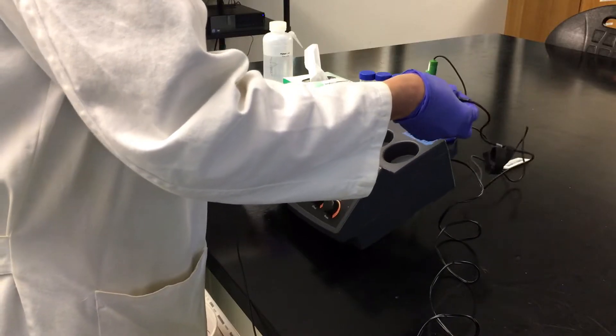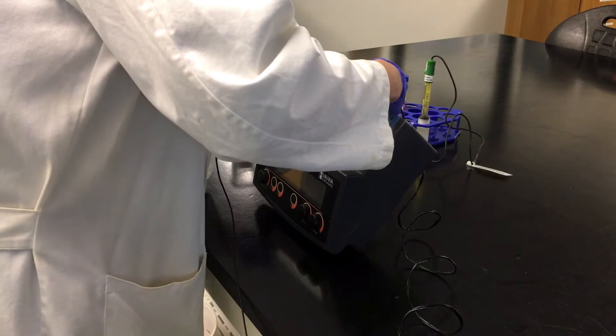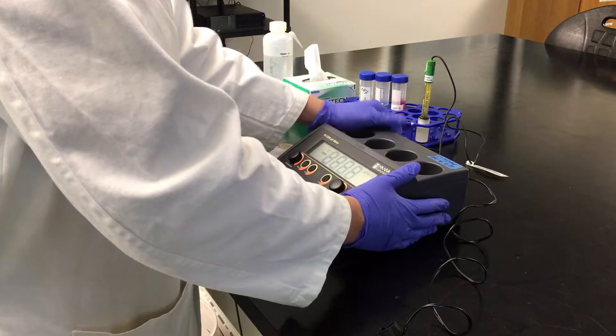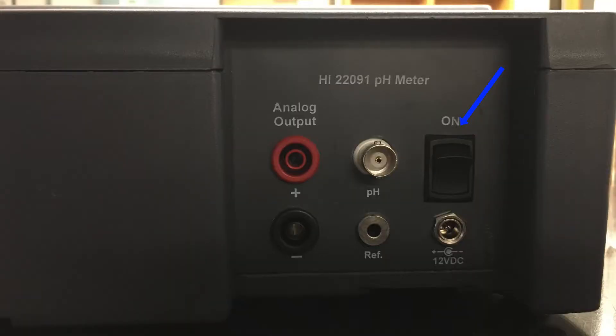otherwise it can create some problems. So you slide it in, and then you just turn. There's also a switch in the back, so we're going to turn it on.